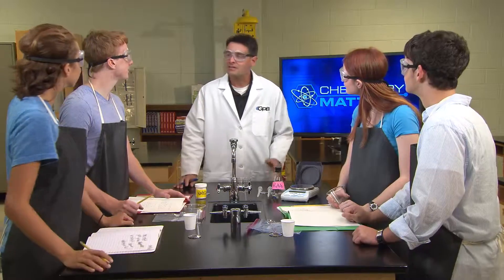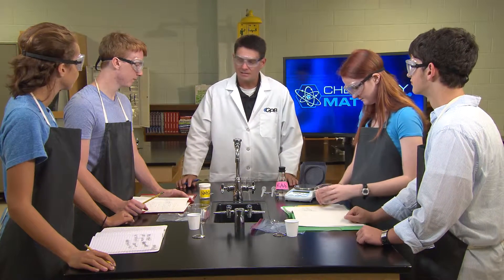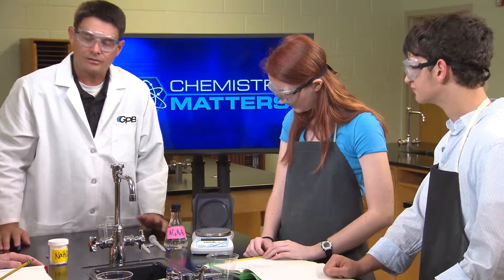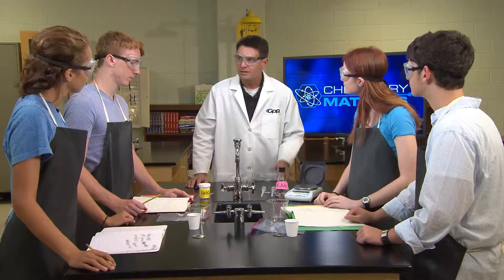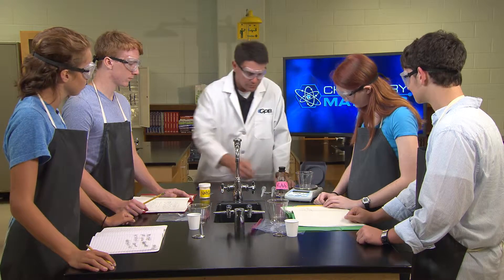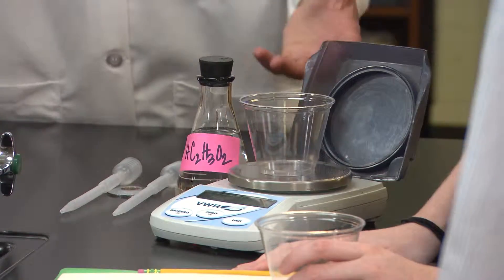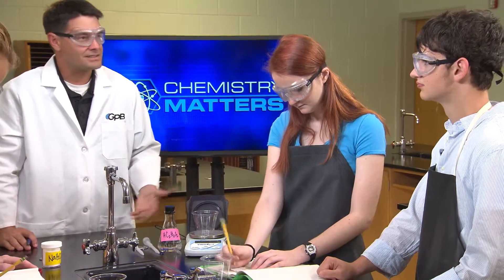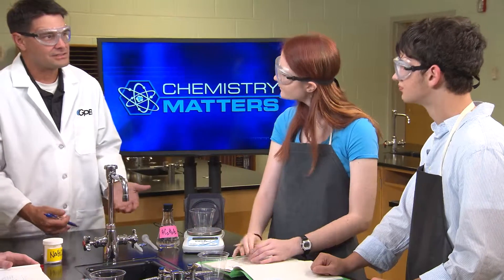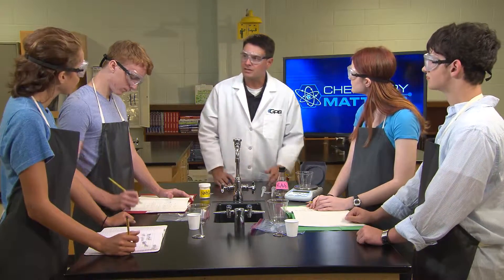I can show you a way to make this a little bit easier. On this electronic balance there's a button that says 'zero' — on some balances it reads 'tare.' We put the empty cup on the balance and press zero, and the number zeroes out, so the balance has disregarded the mass of the cup. Now when we add the acid we'll only see the mass of that substance. Go ahead and complete your measurements.